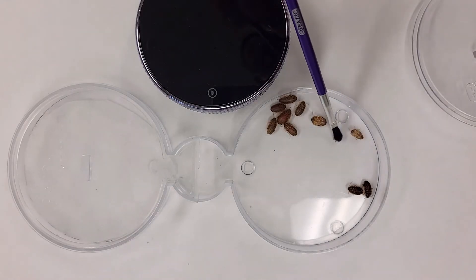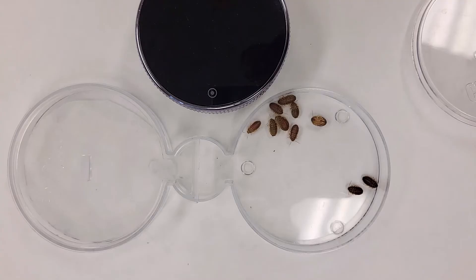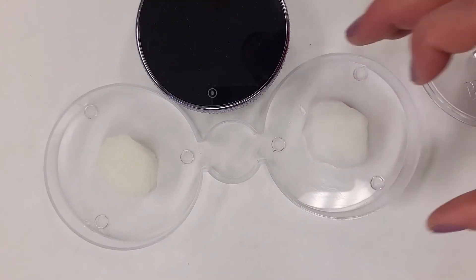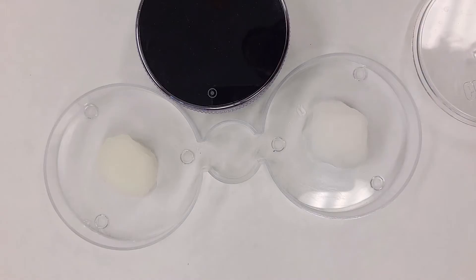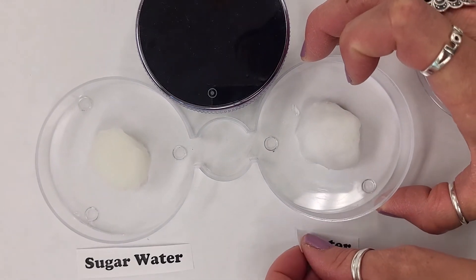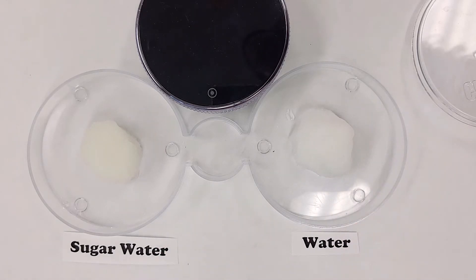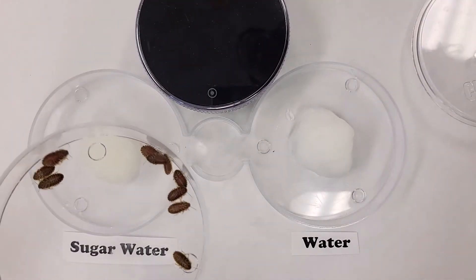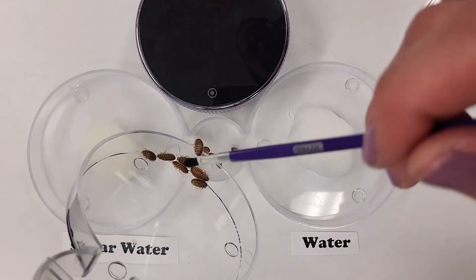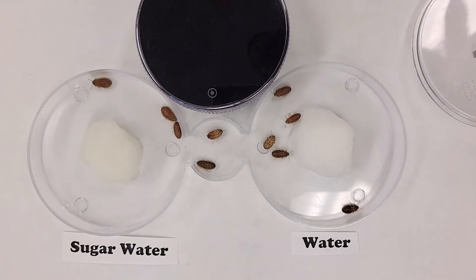We could also do chi-square analysis to see if there is a statistical difference between one side versus the other. What we're going to do next for the second part of the experiment is we are going to put them into a new choice chamber. This time we have sugar water on one side and regular water on the other side, and we're going to see if they have a preference for sugar water versus regular water. So I'm going to put them in the middle to start off with and we're going to observe for 10 minutes.